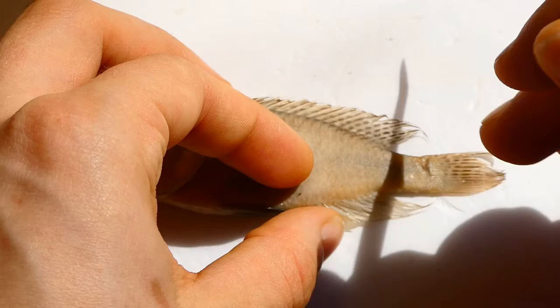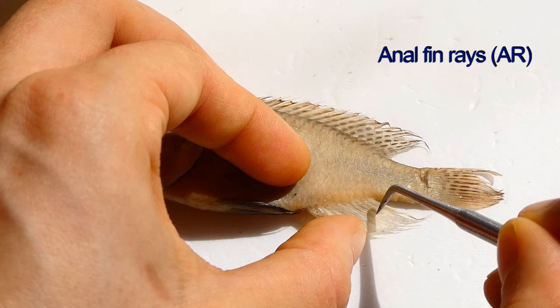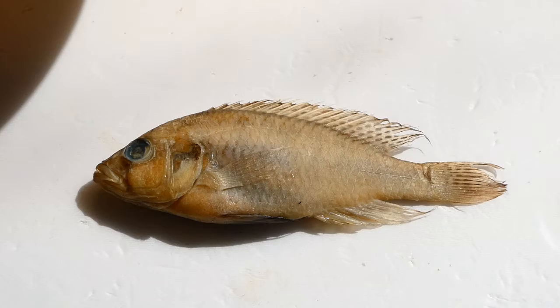And then we do the same for the anal fin. So we've got 1, 2, 3 spines. If we just grab that last spine there: 1, 2, 3, 4, 5, 6, 7, 8 rays.